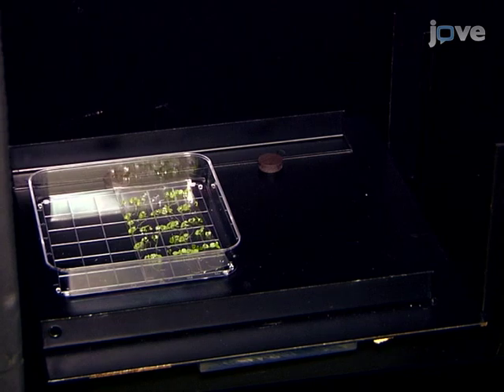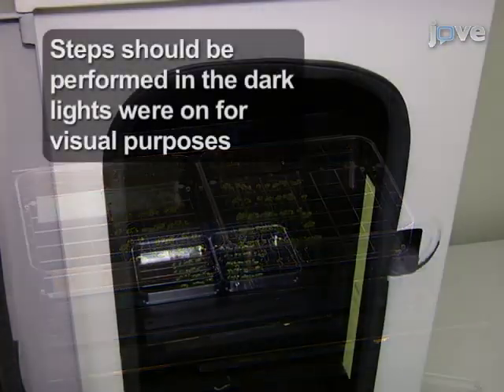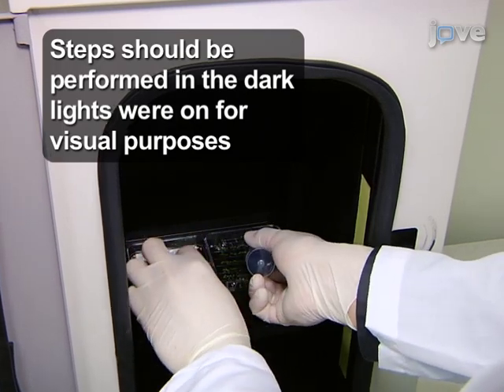To acquire luminescence images, in the dark, place 2 plates next to each other on the stage of the luminescence imaging system. Acquire images immediately upon adding 20 milliliters of stimuli solution to the plates simultaneously.